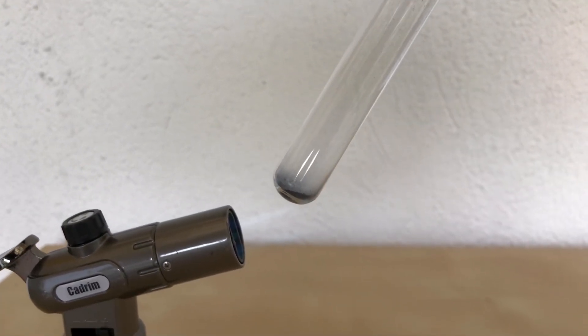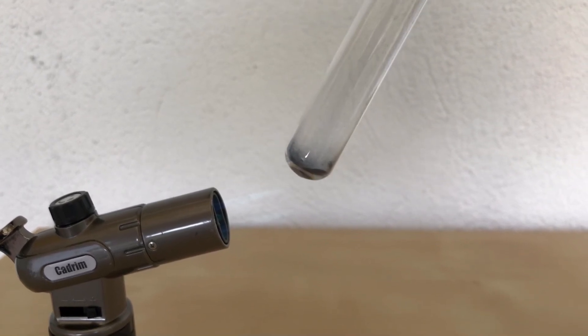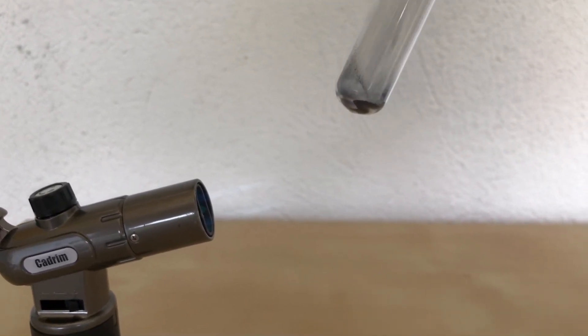Some indigo was packed into this test tube, followed by heating it. Under the right conditions, you will be able to see its beautiful vapor.